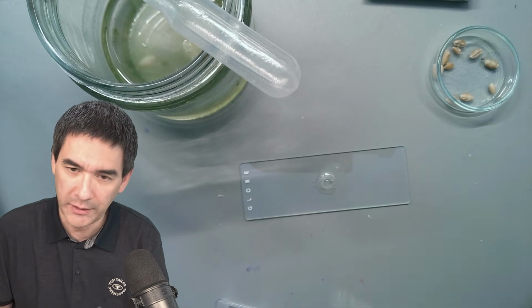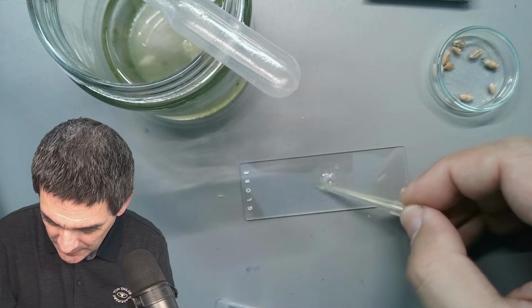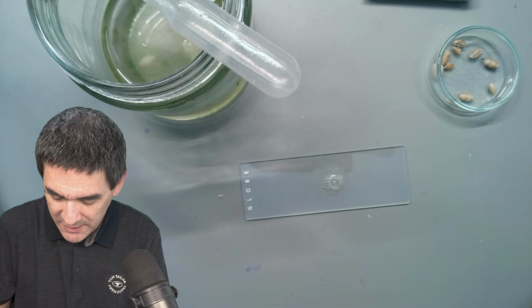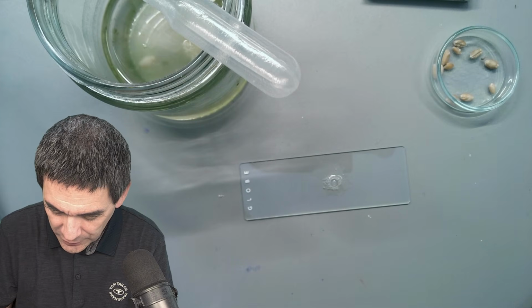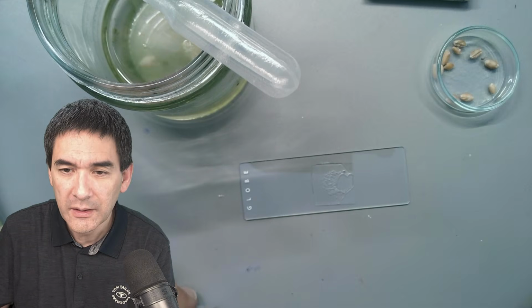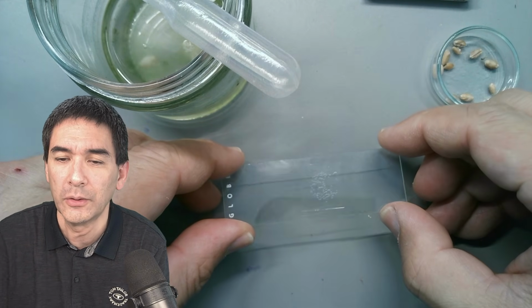You know what? I'm gonna try it in any case. No, let's mix it more. Just want to really make sure. Yeah. Some of the bubbles are going to disappear as we add a cover glass, because they're pushed to the side. But that's also something that we've learned now. When mixing it, don't pull up the pipette. So here we go. Okay, you see that it spreads apart, and maybe some of the bubbles are going to pop. Well, not all of them.